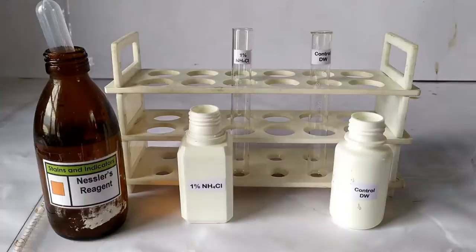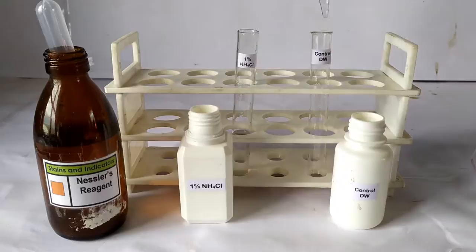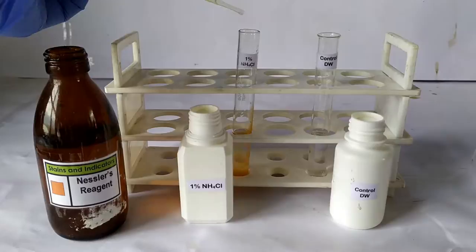To begin the test, take the two test tubes labeled as shown in a test tube stand. In the first test tube, take 5 ml of the sample or 5 ml of ammonium chloride solution. Take 5 ml of ammonia-free distilled water in the control tube.